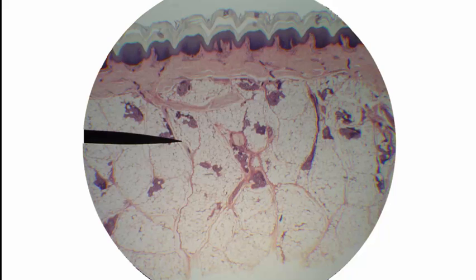I'm Dr. Ren Hartung. For this video, we're going to look at skin histology. What you see right now is an image of thick skin under the microscope at 40 times magnification. And we can talk about the three major layers of skin here.